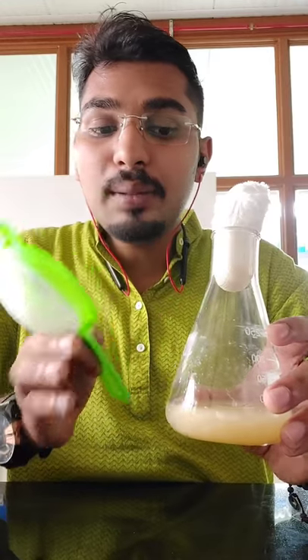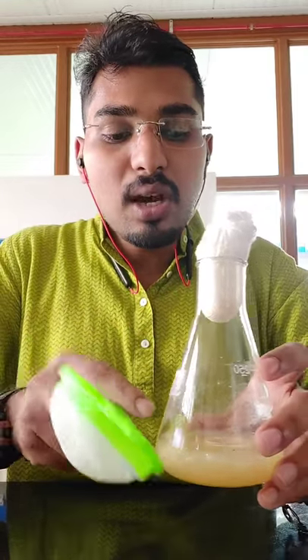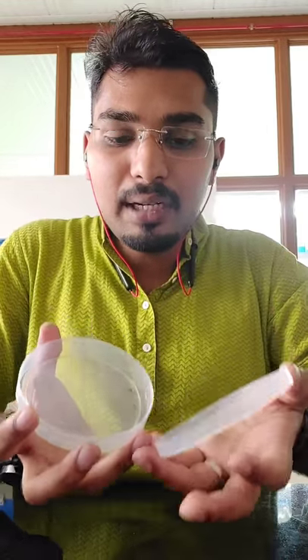We wash with distilled water because the mycelium will have certain media components — if growing in potato dextrose media, there will be saccharides, starch, calcium, nitrogen, and other chemicals. We do not want media components to interfere with our experiment, so we wash them off. Then we collect the fungal biomass, measure the fresh weight, spread it in petri plates, and keep it in a hot air oven at 40 to 45 degrees Celsius. It is advised not to raise the temperature too high as volatile compounds will evaporate — keep it between 35 to 40 degrees Celsius.